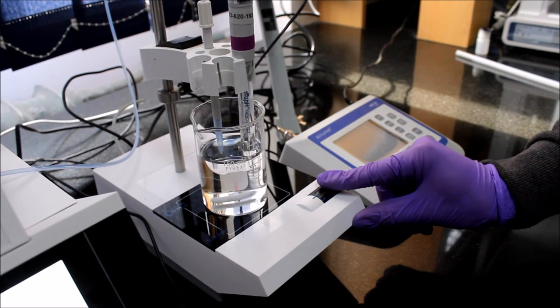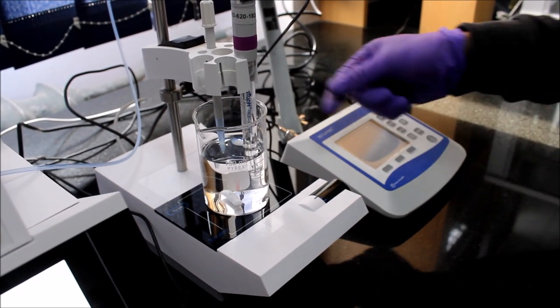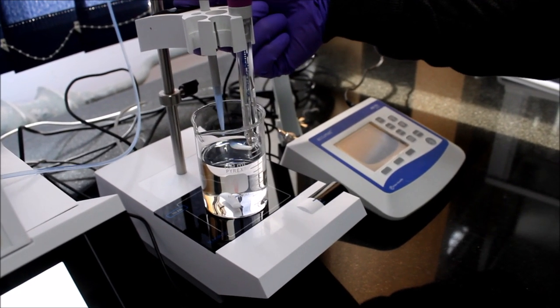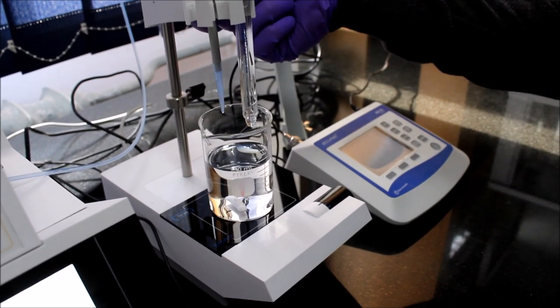When finished, turn off the magnetic stir and pull the holder out of solution. Always wash the tips of both the dispenser and probe with DI water before and after titration.